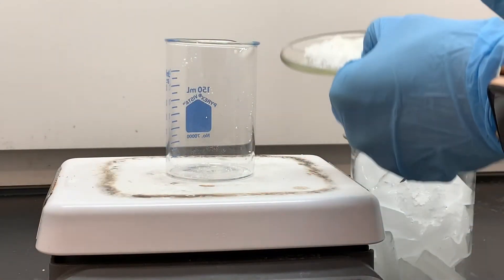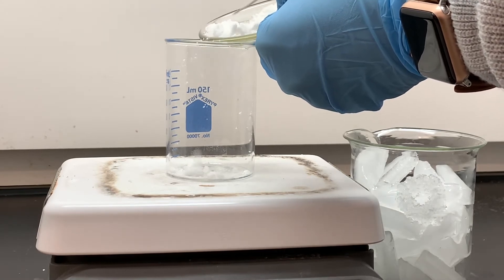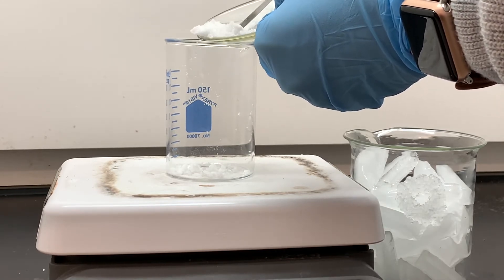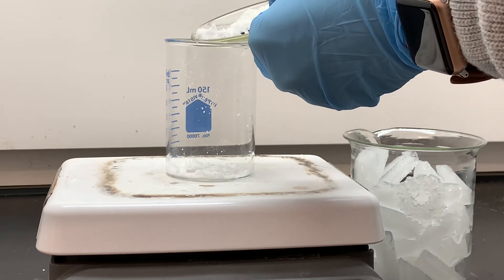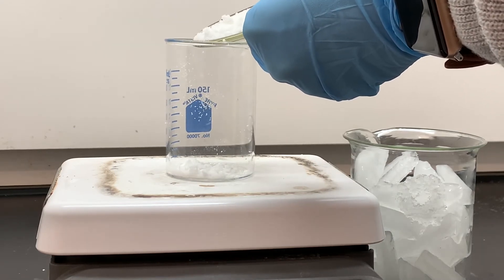This is our crude camphor. We are going to purify it by a sublimation process. In the sublimation process, as you know, sublimation is when you go directly from a solid to a gas, and camphor does that when it's heated gently.